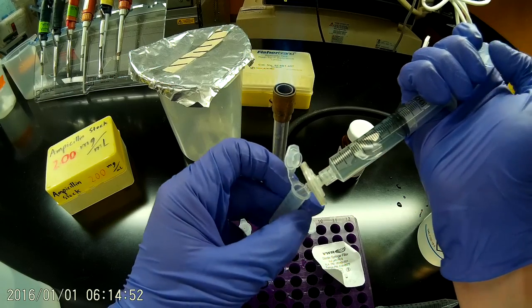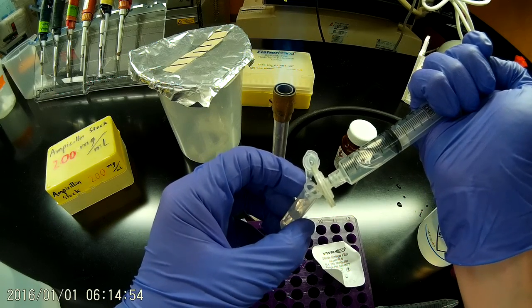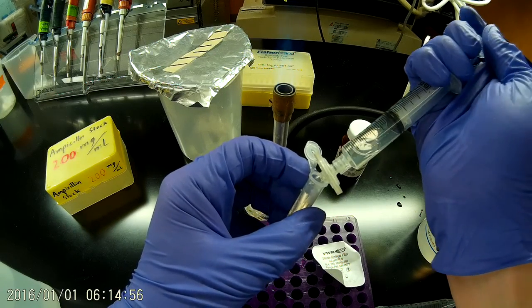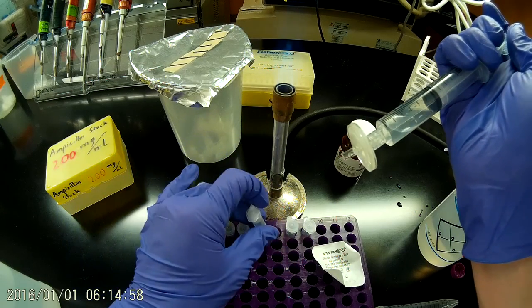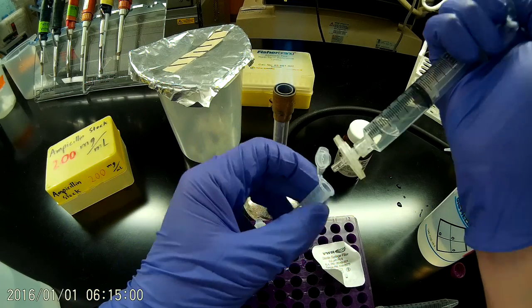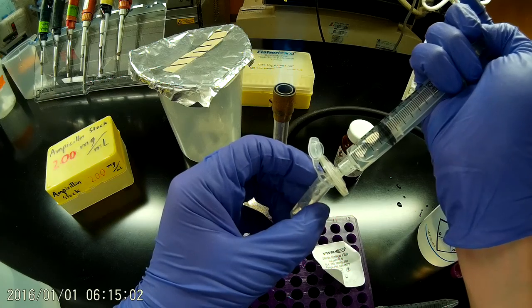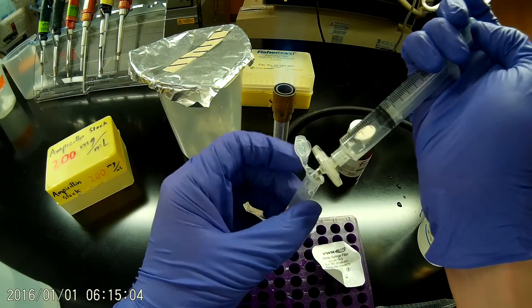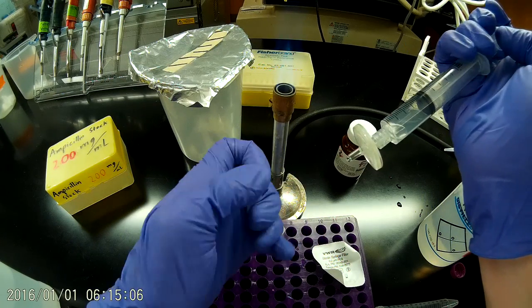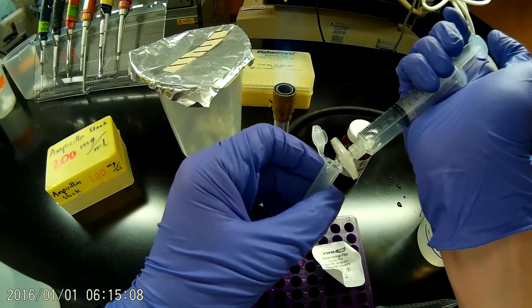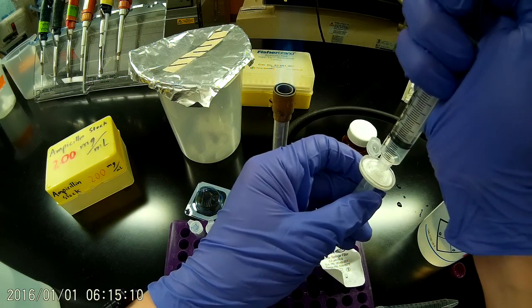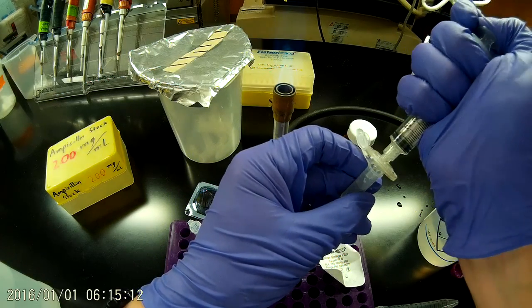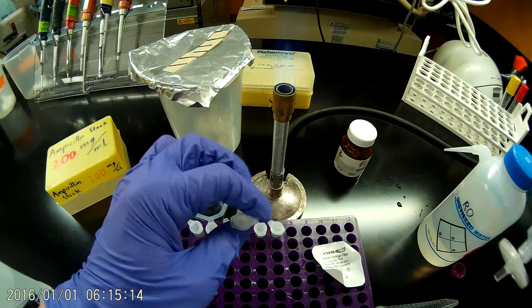And that's a total of the tubes. It looks like my last aliquot is going to be a little bit smaller but that's fine. There we go and that's the last of it.